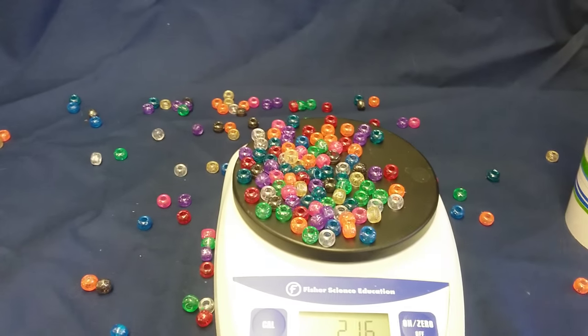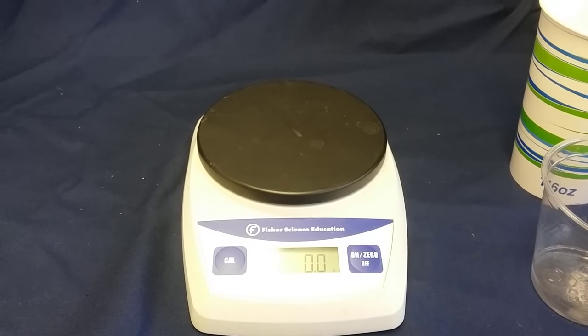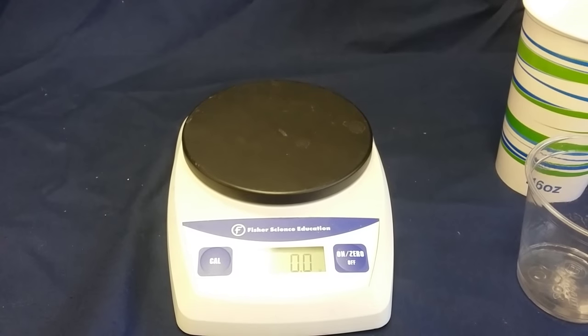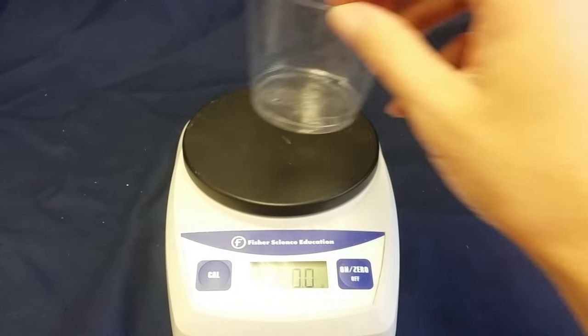Okay, maybe that wasn't the best idea. Okay, let's try that again. But this time, let's put the cup on first.